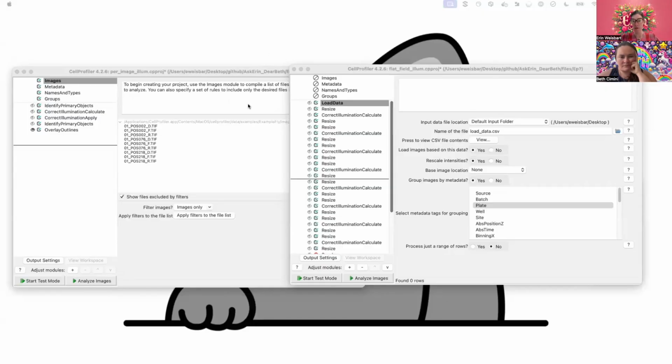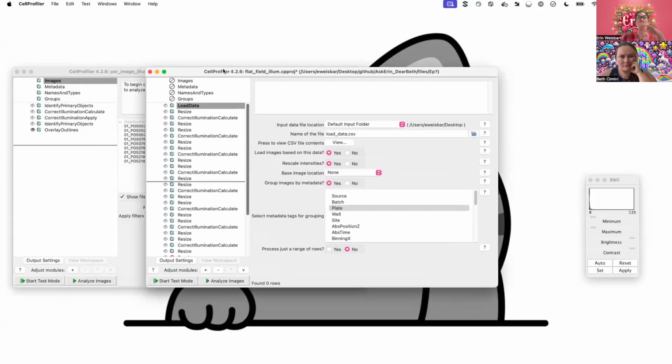So I have two different pipelines here set up for two different illumination corrections that we might do. I'm going to start with this one, which is a flat field illumination correction. Generally we call it flat field illumination correction. Sometimes we call it just an illumination correction function, sometimes just illum correct, depending on how casual we're being. The idea is that with this kind of illumination correction, we are getting rid of illumination artifacts in the path of our microscope.